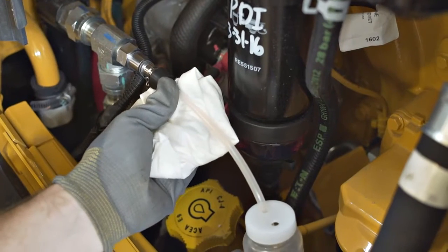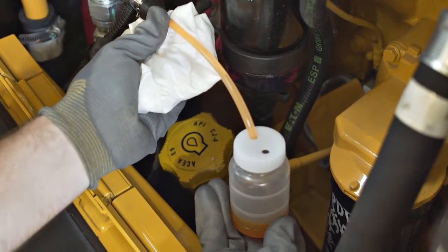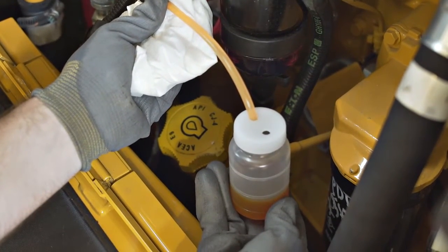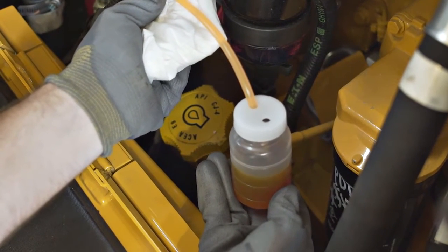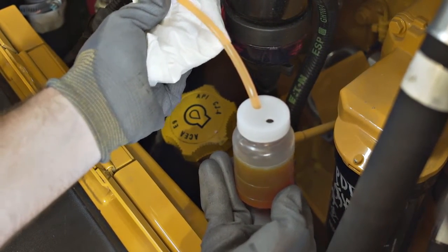When obtaining a sample from a lubricating system, always have the oil warm and thoroughly mixed before sampling. If equipment has been idle, cycle functions so that the fluid is agitated throughout the system.